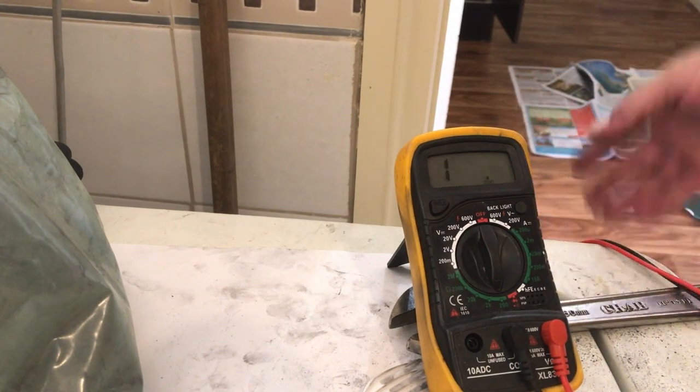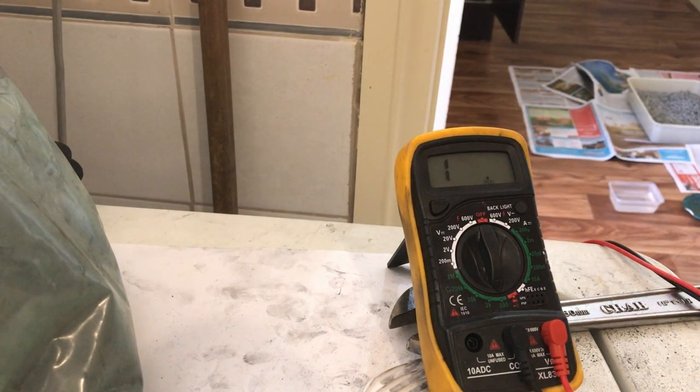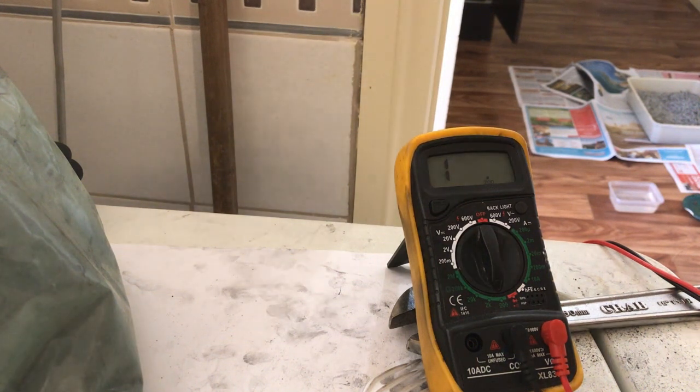So that's the lot of tests for now. I'm going to reduce the acid again just in case I'm not at 98% — it's only a bit of hit and miss at the moment. It did have lots of sulfur dioxide gas coming off, but maybe it needs to be thicker to reach 98%. I'll get back with those results later.